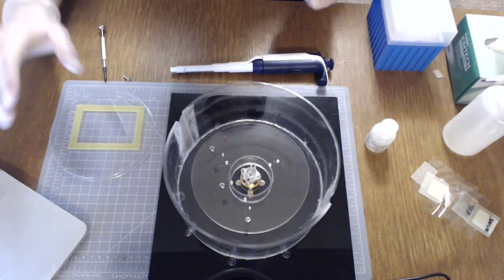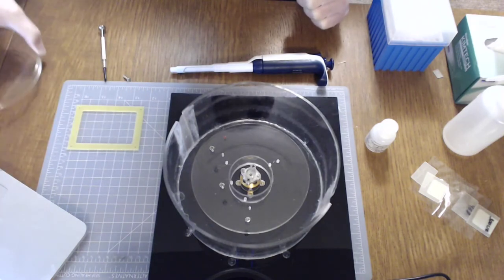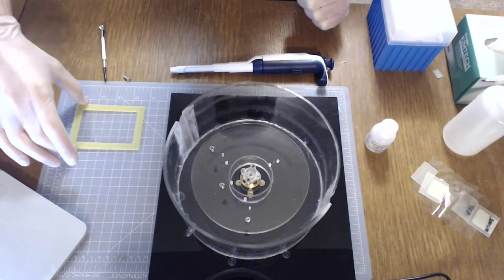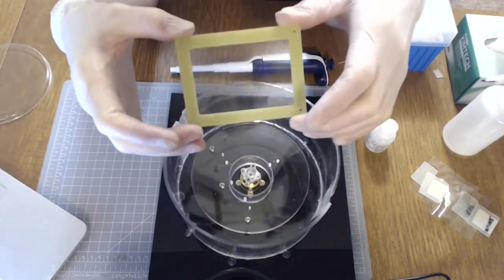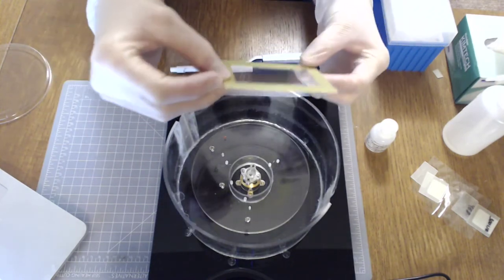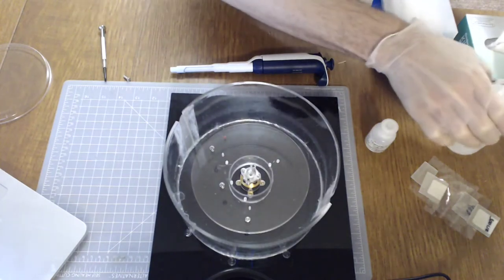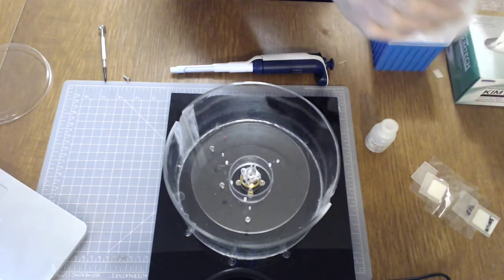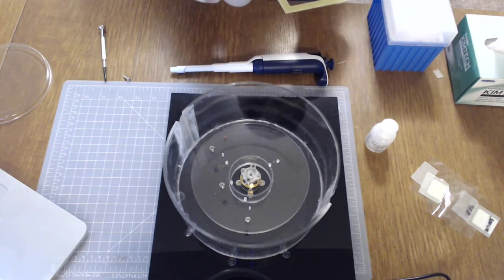These videos were made during the COVID-19 outbreak so at MISL we've been working from home almost entirely for the past few months. So in order to keep projects going at home I had to put together this very DIY spin coater. It's just a quadcopter brushless motor and some acrylic to make a frame around it and some screws to hold parts down onto the spinner.